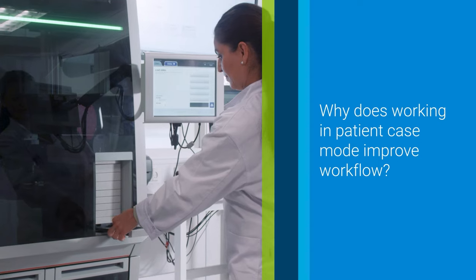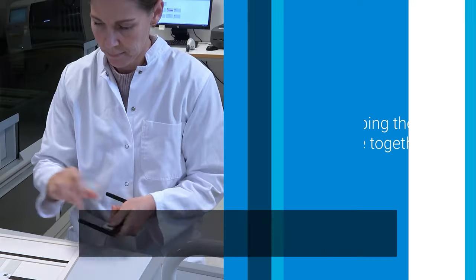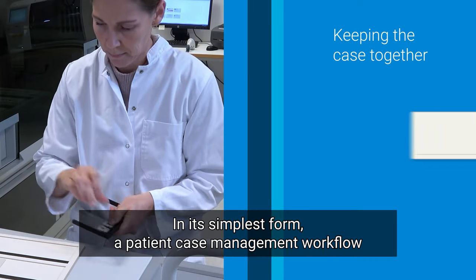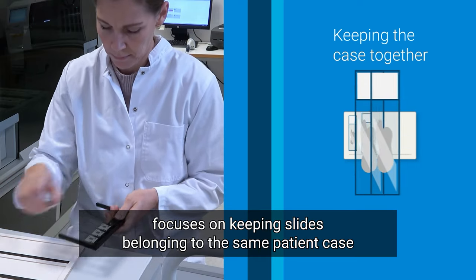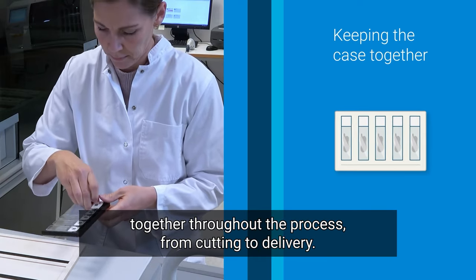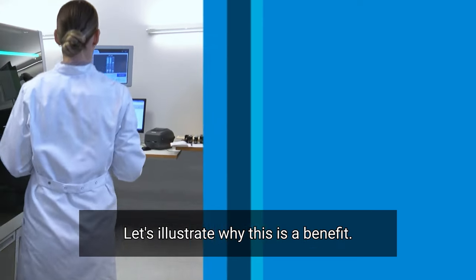Why does working in patient case mode improve workflow? In its simplest form, a patient case management workflow focuses on keeping slides belonging to the same patient case together throughout the process, from cutting to delivery. Let's illustrate why this is a benefit.